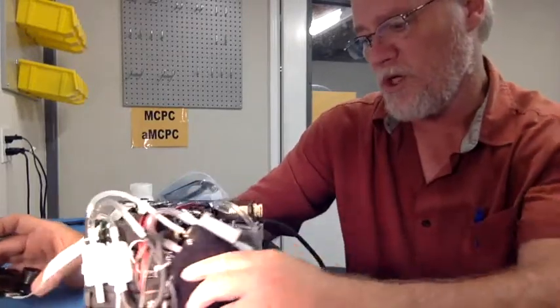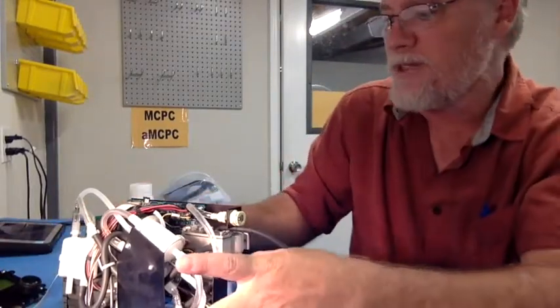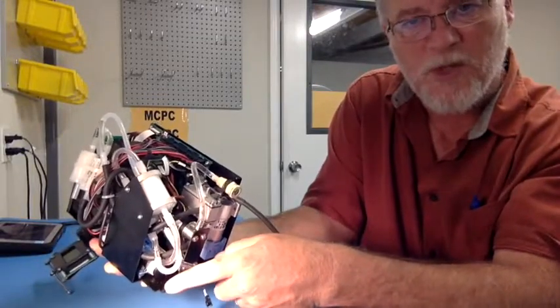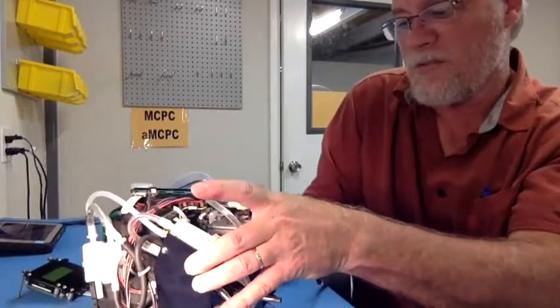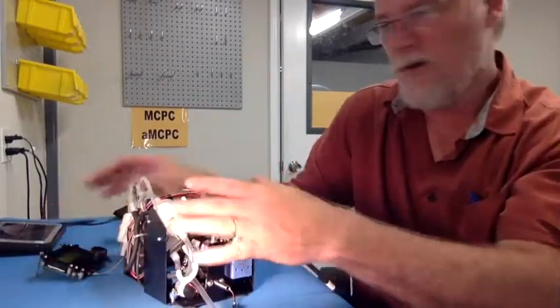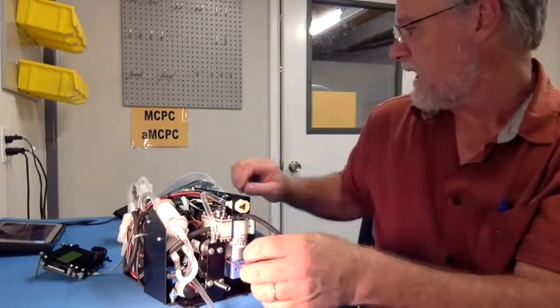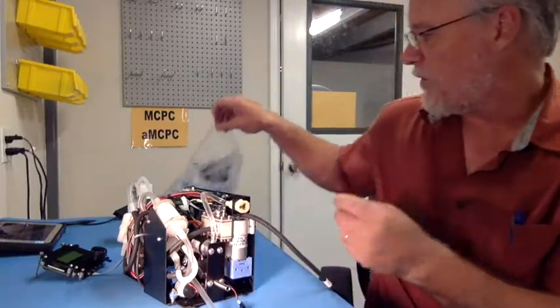Be sure when you mount the unit, you use these convenient mounting tabs that we provided. For example, here, just like this, right through the metal bracketry. You can use standoffs underneath if you like, or you can just let this bottom surface rest right on a plate, for example, so that you can hold this down nice and solid. You'll see here a connector sticking out. This is actually to attach a cooling fan that is supplied with your unit.